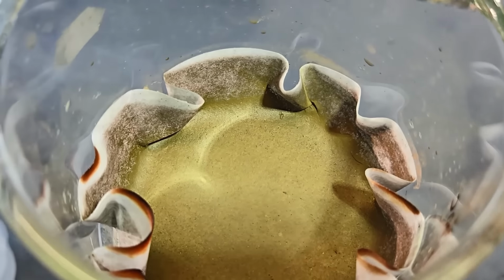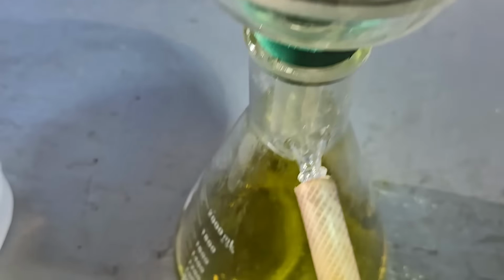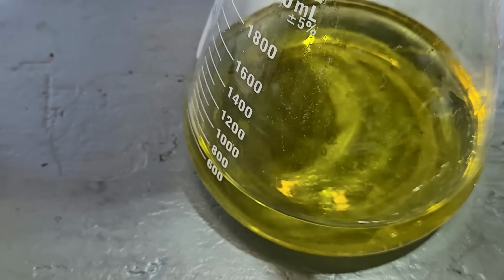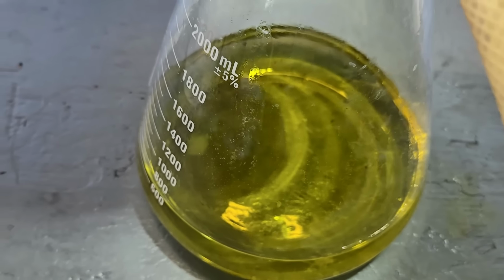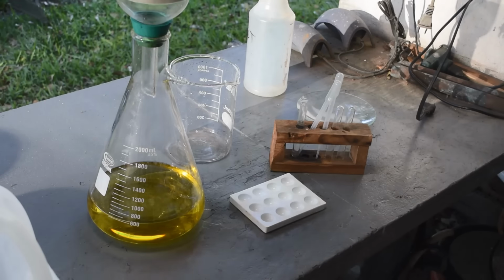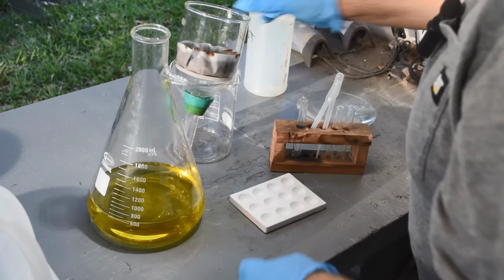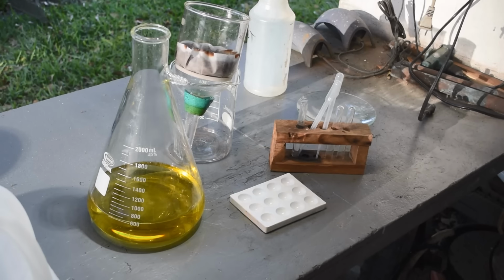Oh yeah, that's a much better looking stuff after running a bunch of distilled water over it. I want to do a stannous chloride test on the liquid down here in the flask, just to make sure we don't have any dissolved gold in it. All right, let's set this aside for now over here and get a little bit of that liquid.